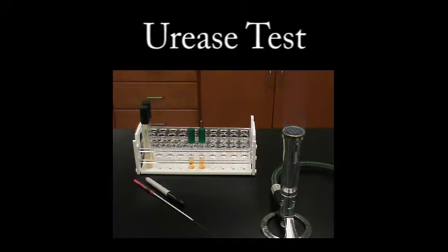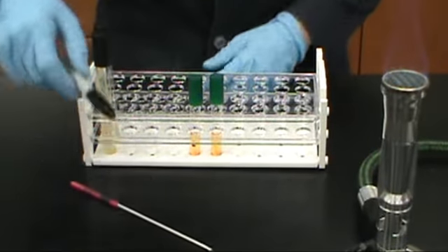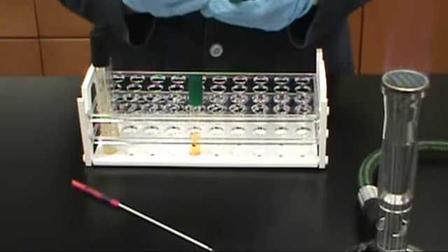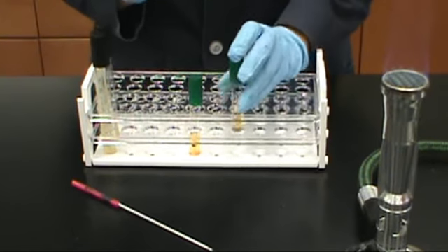The urease test. The urease test is a simple broth inoculation. You will be inoculating 2 different urease broths. Be sure to label the tubes with the name of the bacteria prior to inoculation.